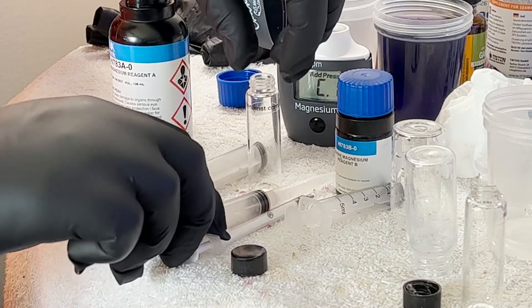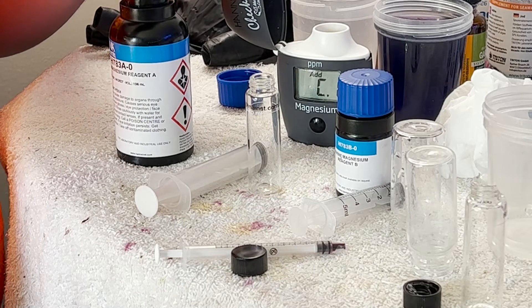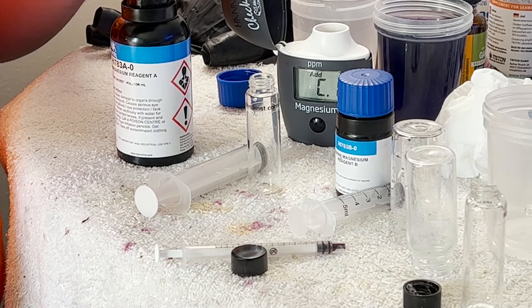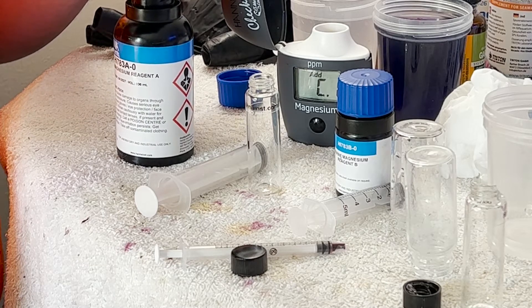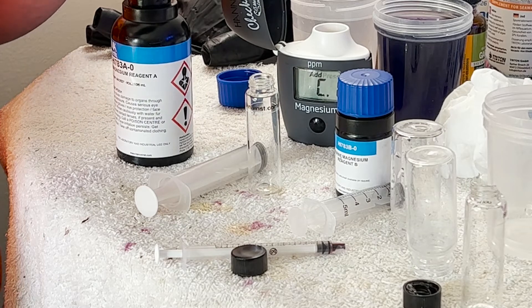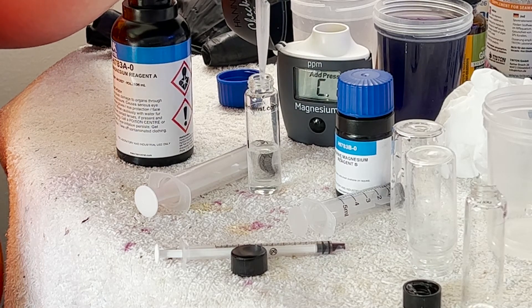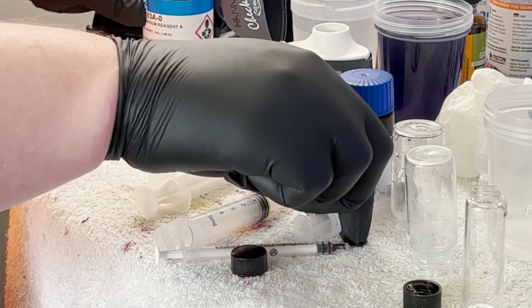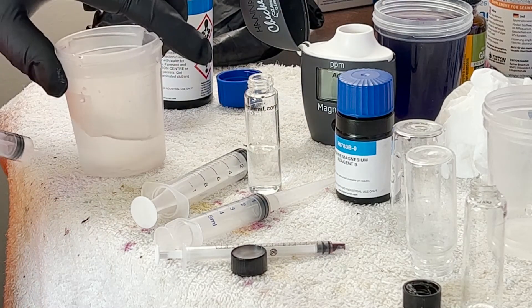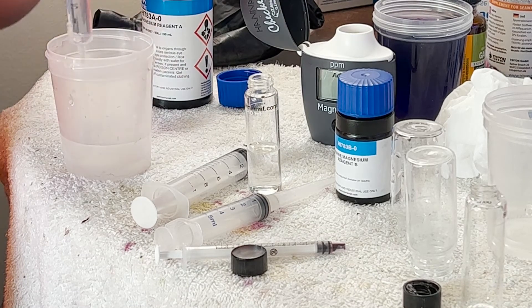You've literally got to do everything perfectly. This syringe is not going to seal anymore no matter how hard I try. I see a lot of bubbles in the top, which means we're getting air leakage, which means this is already probably going to be wildly inaccurate. I was also using my 10cc syringe for other tests, but because you can't see the five milliliter line, it's just grossly inaccurate again.